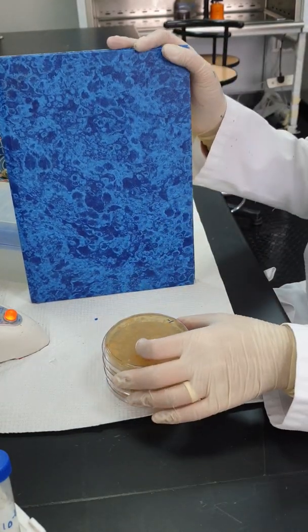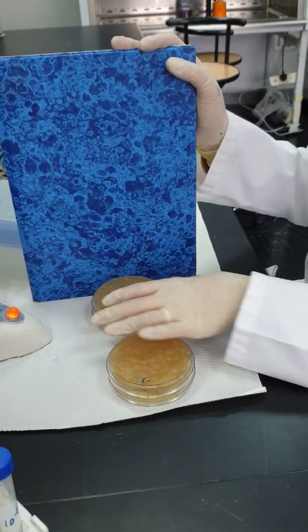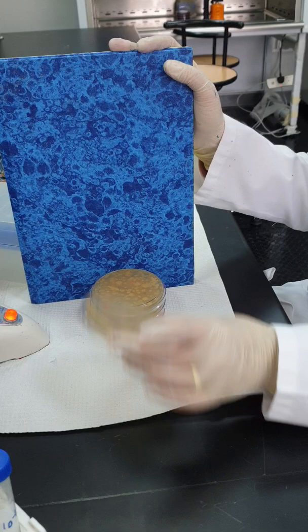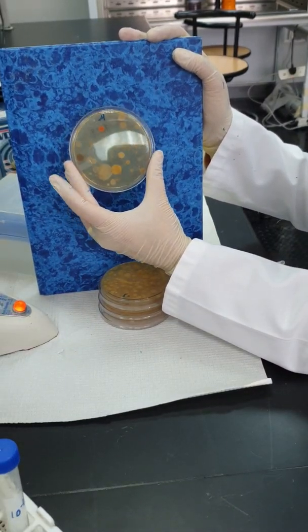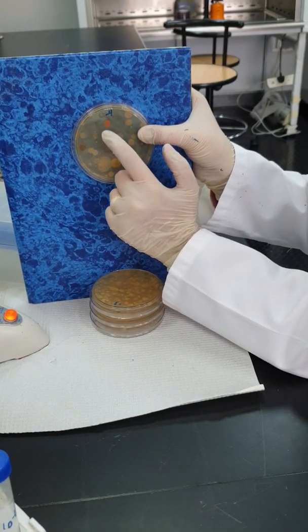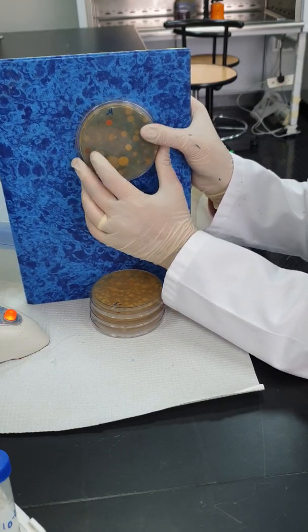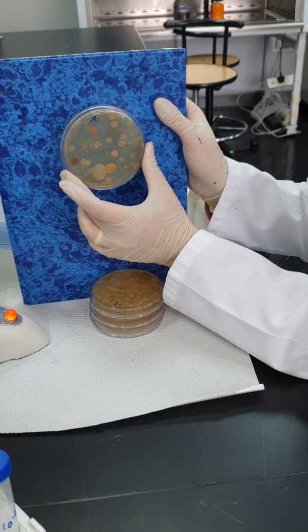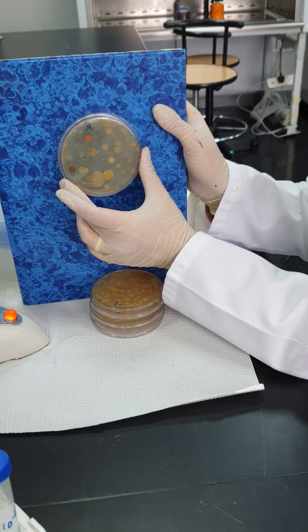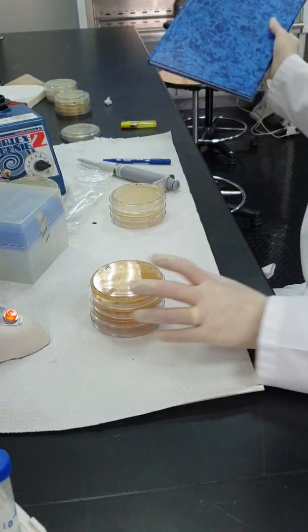This is also a serial dilution of soil. This is 10 to the power minus 1, very thick. Minus 2, still very thick. Minus 3, the number of bacteria starts becoming visible. And here the minus 4 is countable. I wanted to show you that in the soil we have different types of bacteria. You can identify this yellow large colony, this medium orange colony, this red or brown medium-sized colony. You need to count all of them to calculate the total CFU, and divide this number by the plated amount times the dilution. That's it for the spread plate method. Hope it's clear.